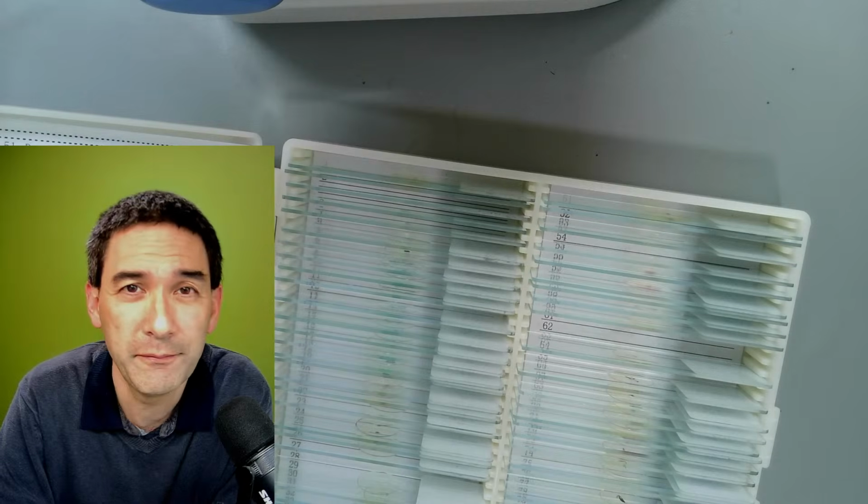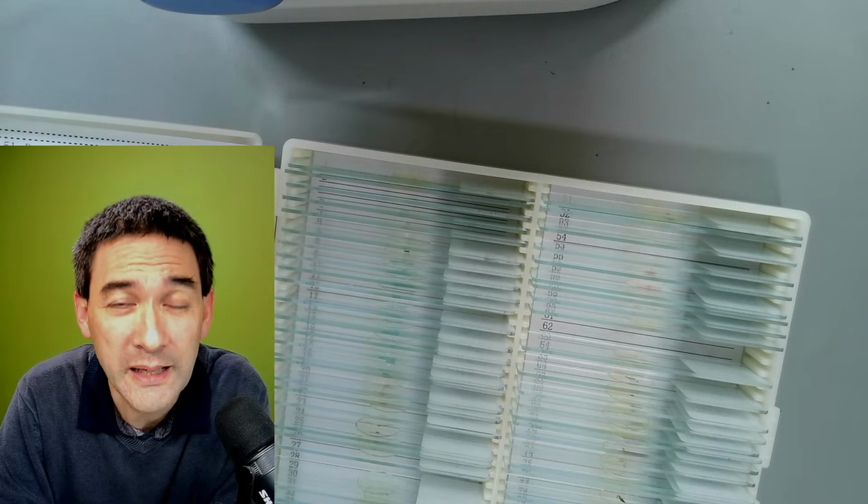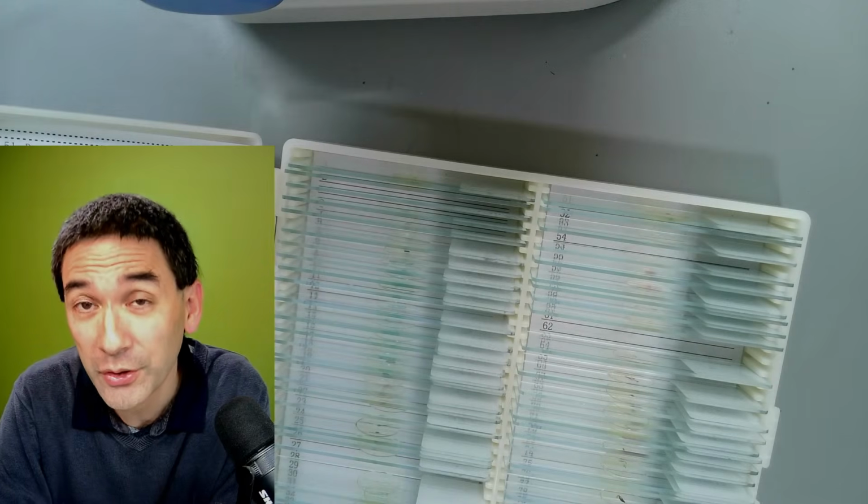I found out, a combination of 3D printing I've tried in the past as well. I've been through so many things. I've bought commercial adapters which worked well on one microscope and pretty badly on another one. Interestingly, that shows that the adapters also have to fit a little bit with the optics of the microscope. So you see, there is not one size fits all. That's a little bit part of the hobby as well.